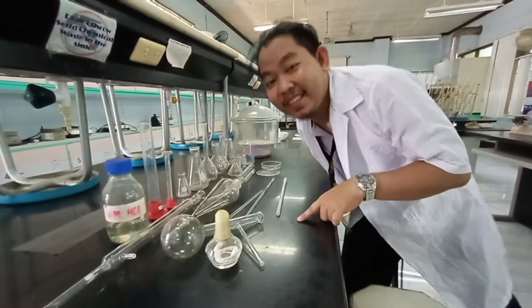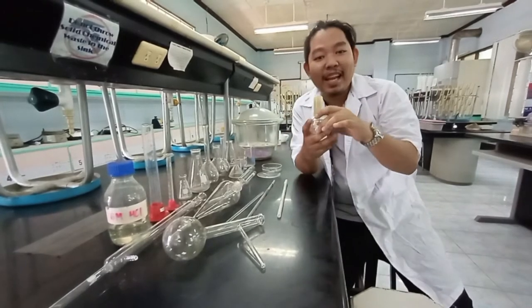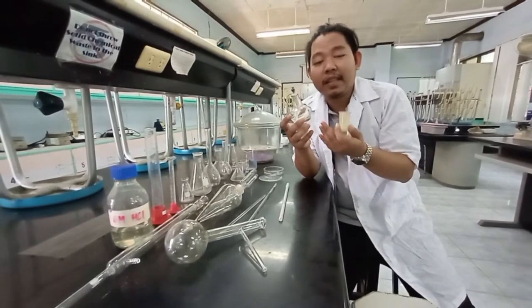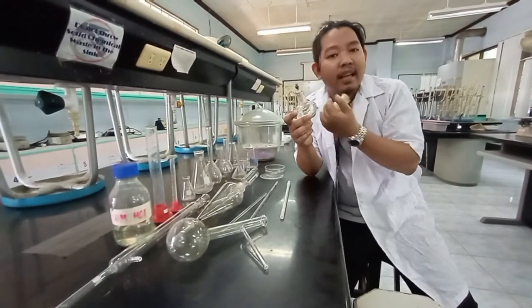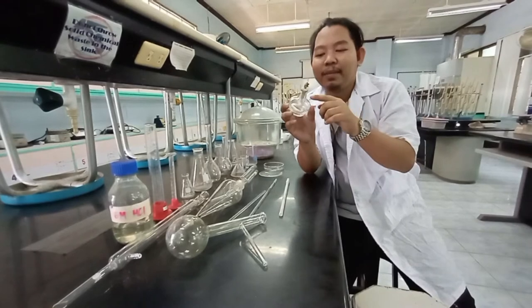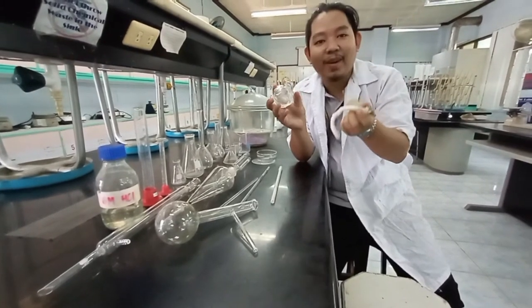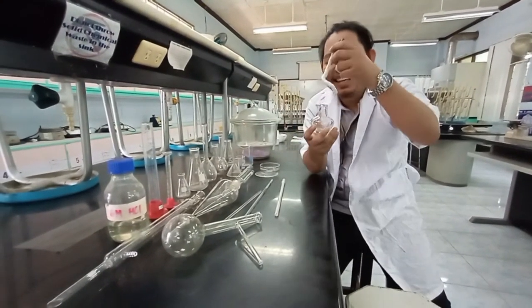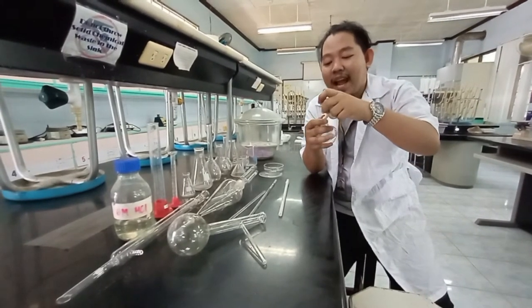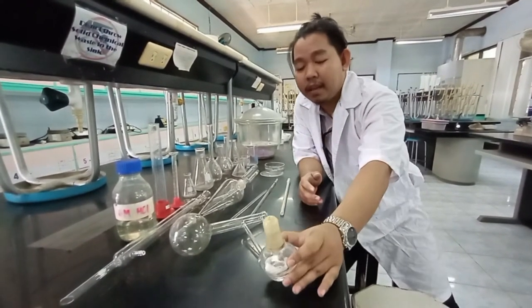Alright, we'll start with our different glasswares. Here you have an alcohol lamp. This is what we usually use in getting a small amount of temperature or in heating some liquids or solids, usually in test tubes. To avoid soot, alcohol is used because it's a clean fuel. So this is your alcohol lamp — what we usually use when we need a small amount of flame in a short period of time.